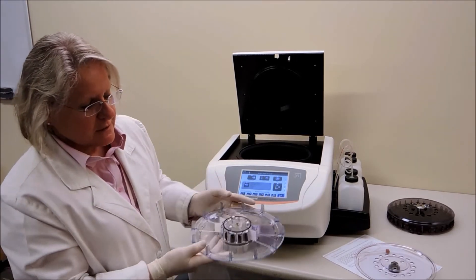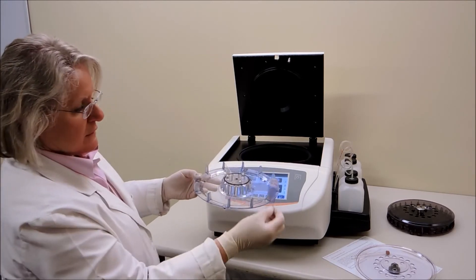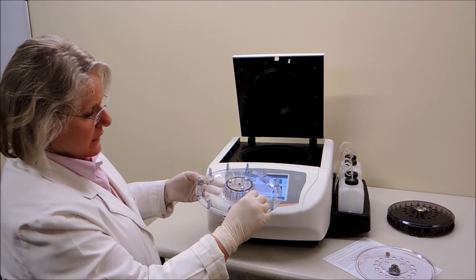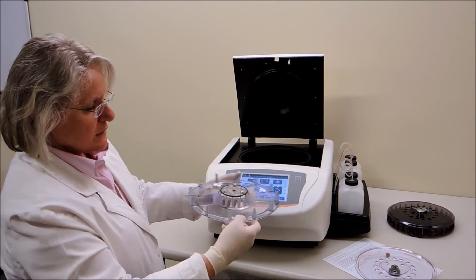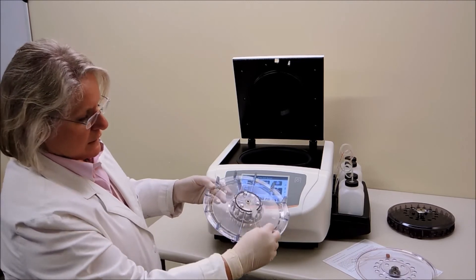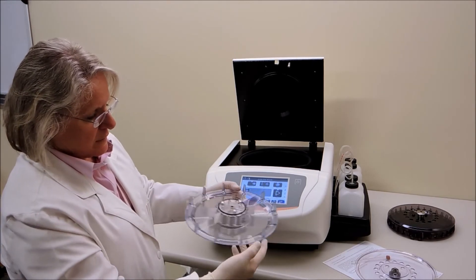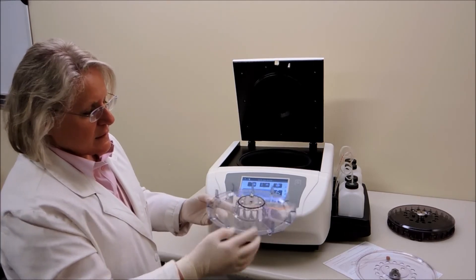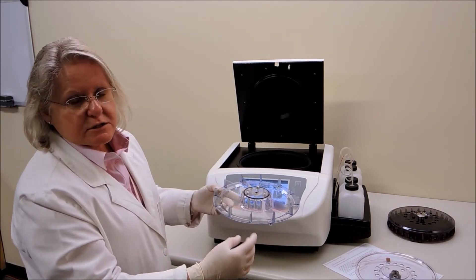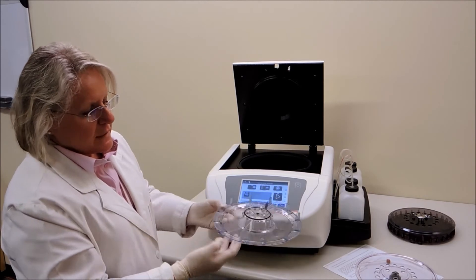You can see the specimen facing me on the right-hand side. If loading with the blood film facing you on the right-hand side, rotate around and you would show your other blood film being loaded here, also facing you on the right-hand side. As you keep rotating around, the blood film must be facing the nozzles as it goes around in the circle inside the stainer.